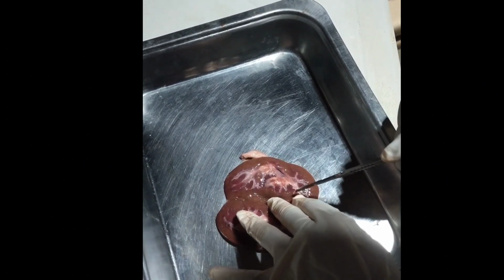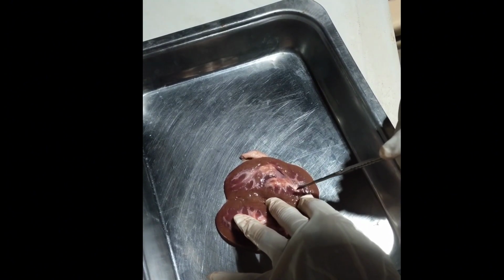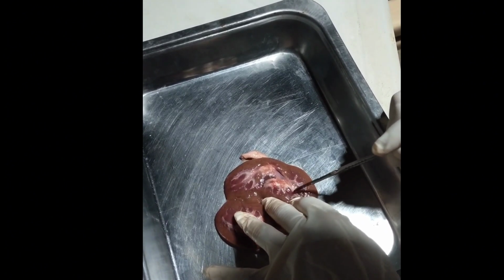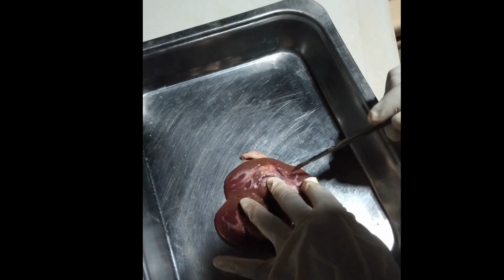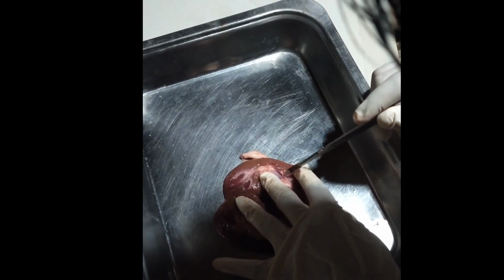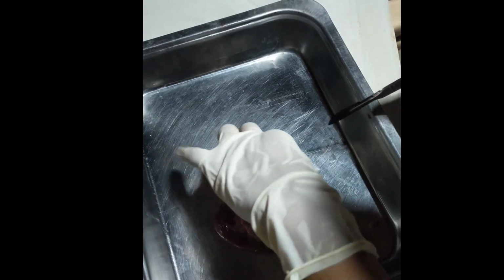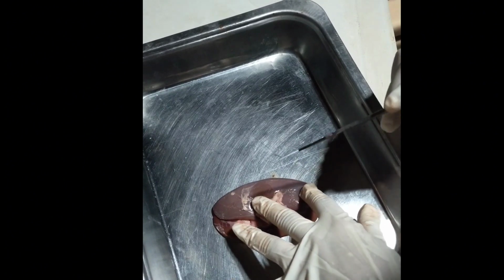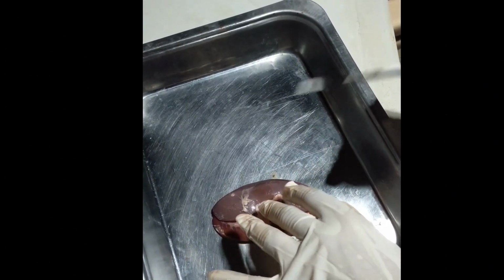And from the arcuate vein, it will go into an interlobar vein, just here alongside the renal pyramids. And from the interlobar vein, the blood will go here into the renal vein and exit right here. Still the renal vein, and it will go into the inferior vena cava, going back to the heart for circulation.